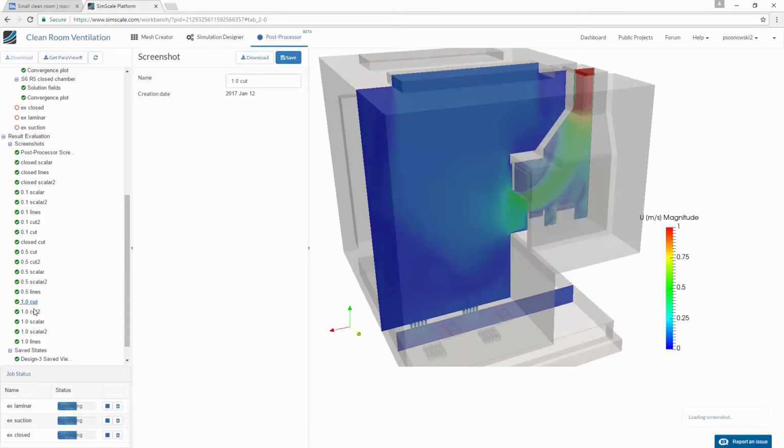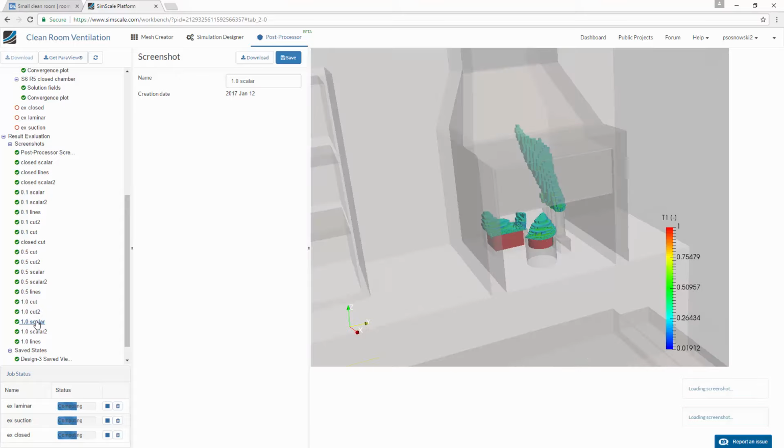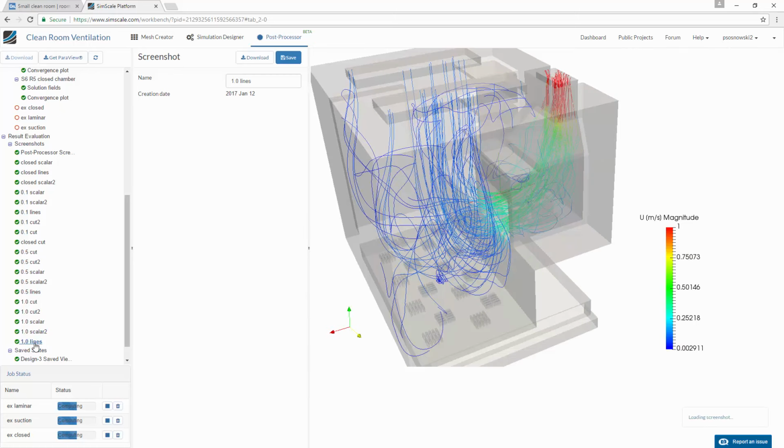And the last setup is the very fast moving 1 meter per second suction at the chamber, and the behavior of the gases themselves. And with this we have a very fast, this is again 30% concentration of the contaminant. It is being immediately distributed and sucked away. In this case we have up to 10% concentration. It's being taken away and provides good operation conditions.